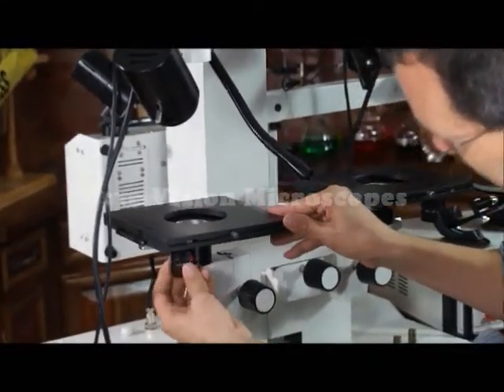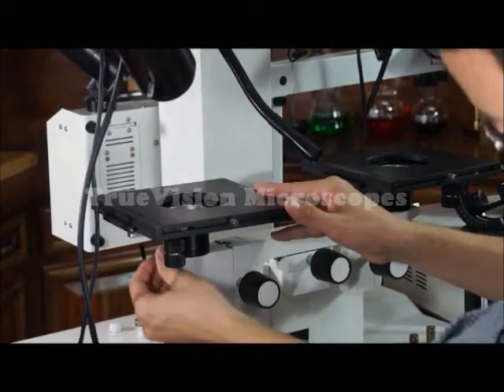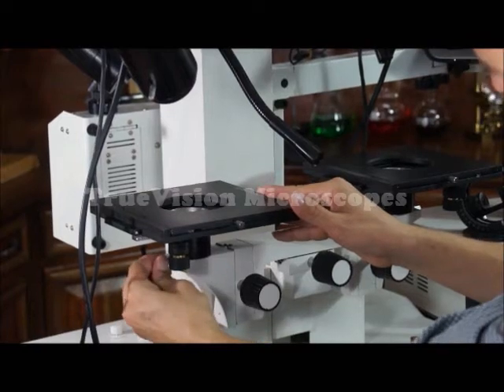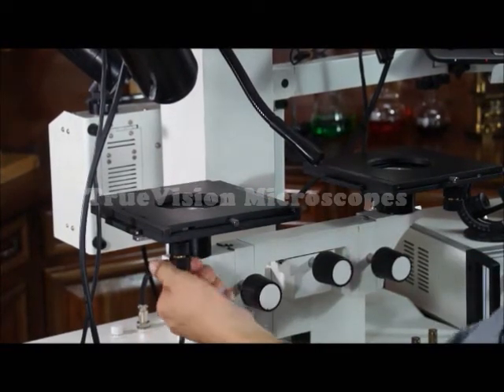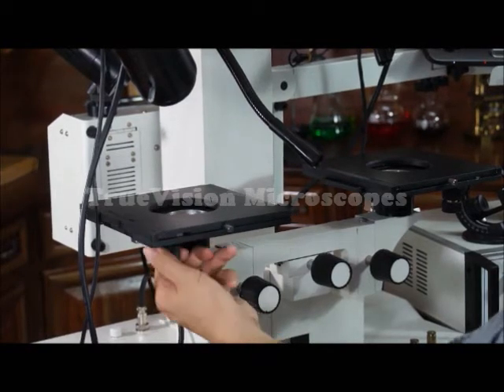These are the XY stage movement knobs, the Y direction and the X direction.